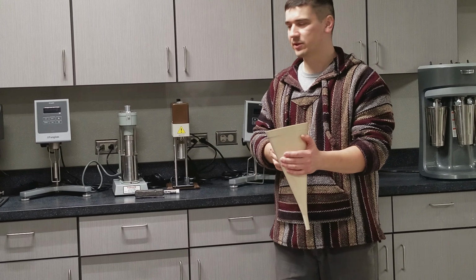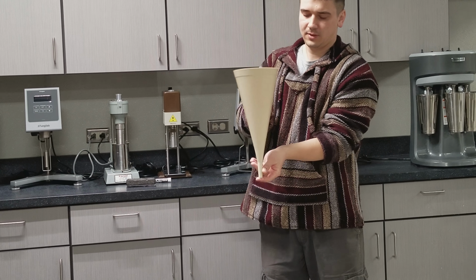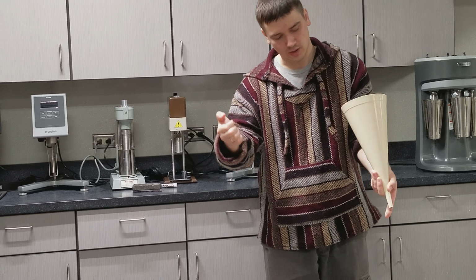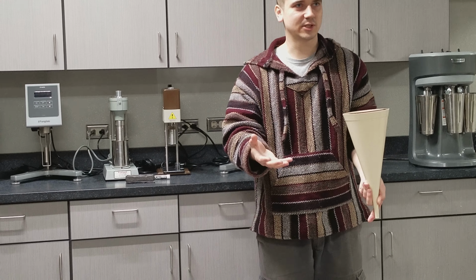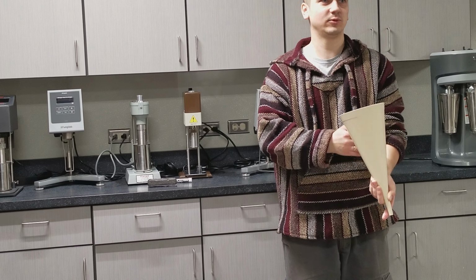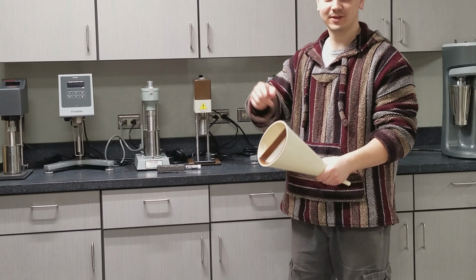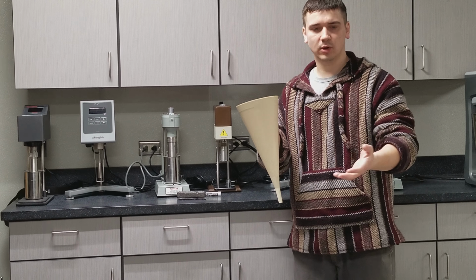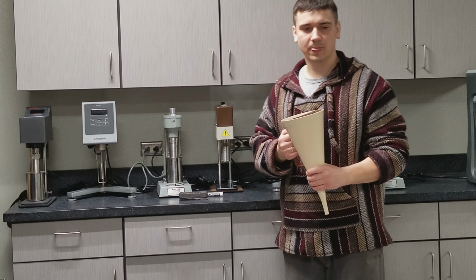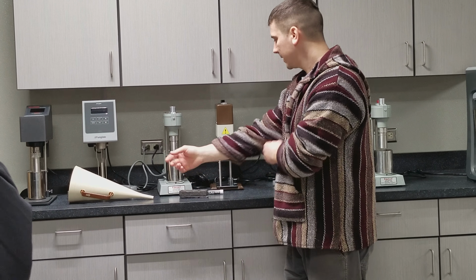Basically, the way this experiment is going to go, at least this part, you're going to be filling it up with mud, covering this with your finger, taking a stopwatch, opening the finger, and recording the time it takes. Less viscous fluids will flow faster. Viscous fluids will flow slower. Okay? And then you'll be writing a lab report on all those measurements, converting this time with a given formula into a viscosity in viscosity units, which are centipoise. Okay?